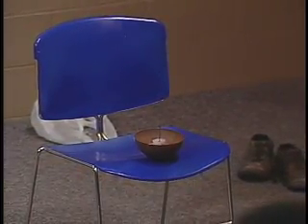This is actually a lot more fun when the lights are out. Exothermic reaction. And then we'll get an even more exothermic one when we burn the magnesium — that gives you a very hot flame. Remember how white that flame is. And then when the magnesium burns down into this mixture, it'll give it enough of a kick in the pants to get it to go. There goes the magnesium.